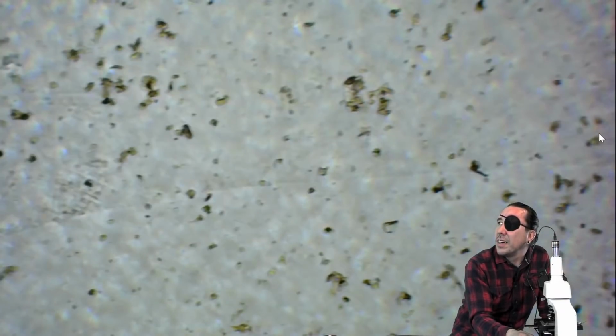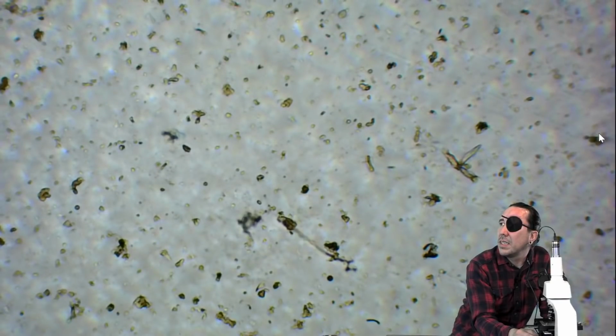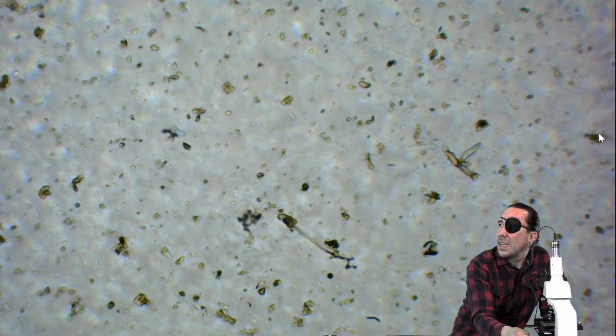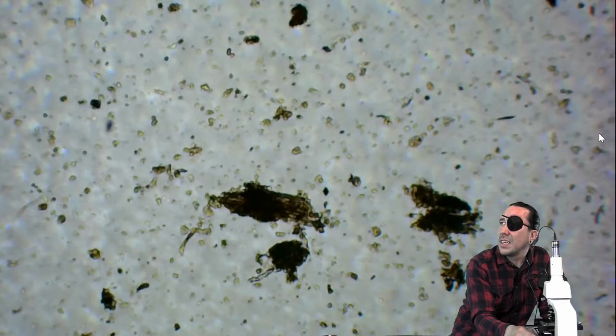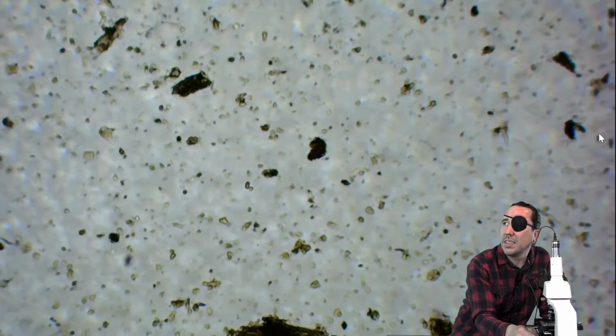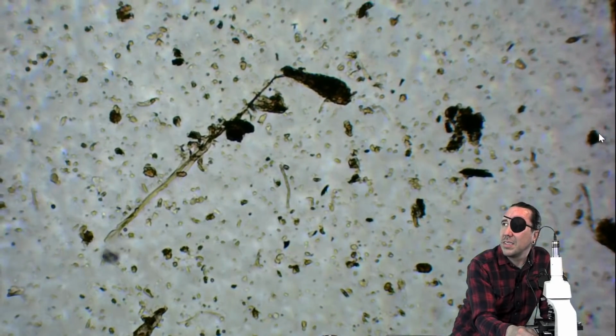All right, we're going to move over here. I should have two more passes up and down. I don't think that's anything. Are you finding anything fun? I found a little arthropod on the last slide. Oh, sweet.